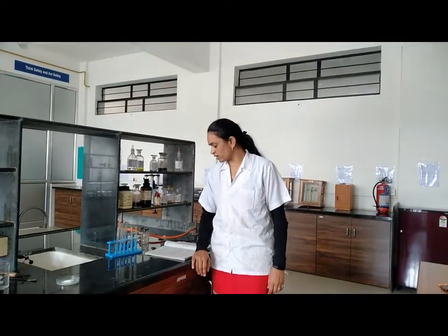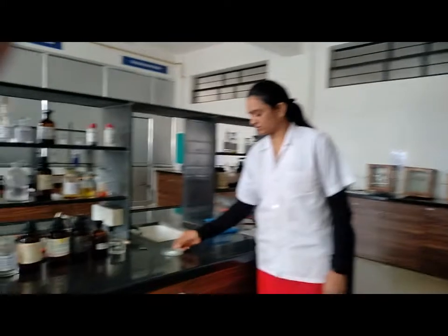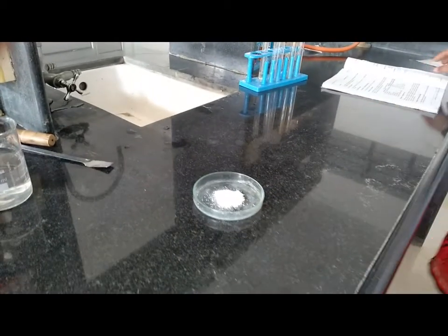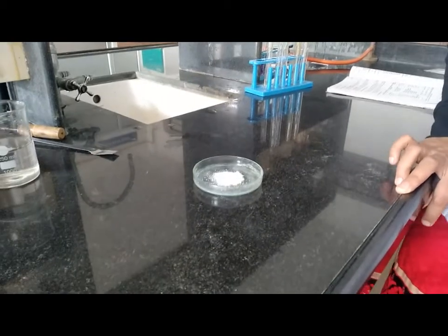To perform and report identification test on the given sample of ampicillin trihydrate as per Indian Pharmacopoeia. Starting with description: the sample is a white crystalline powder and almost odorless — that means it complies the test as per IP.